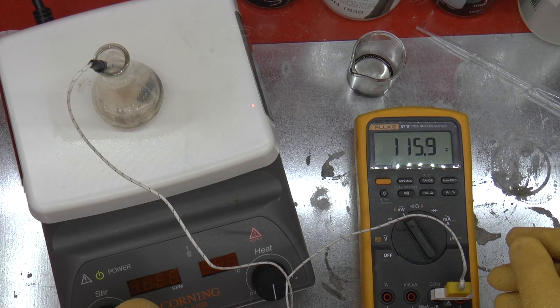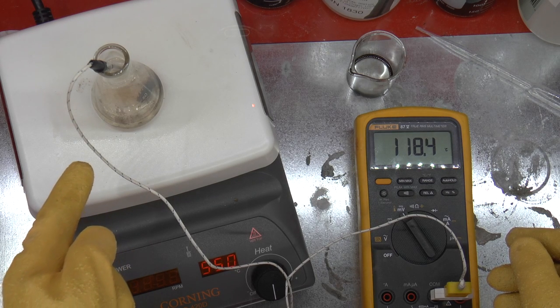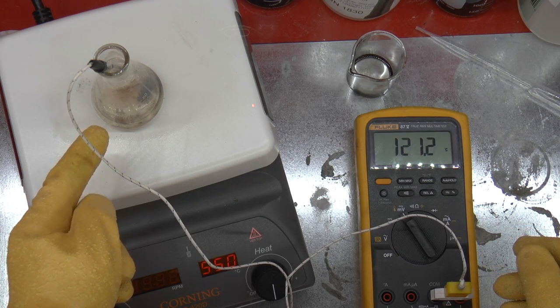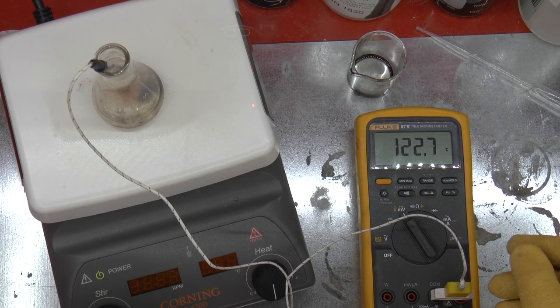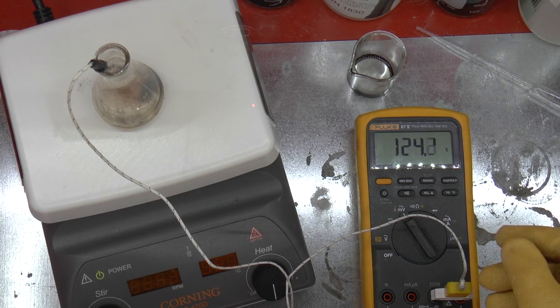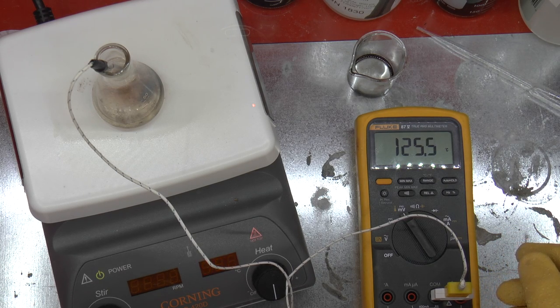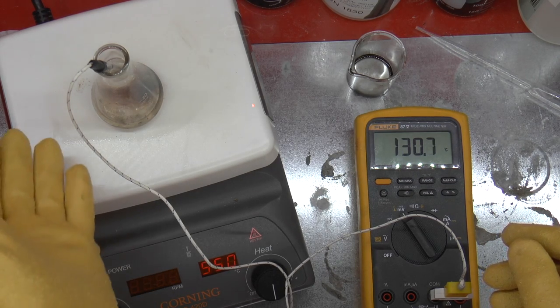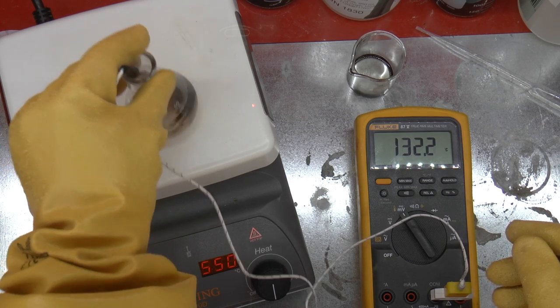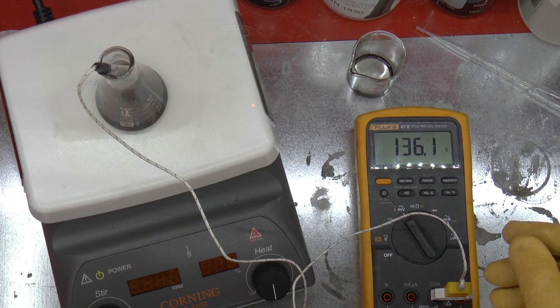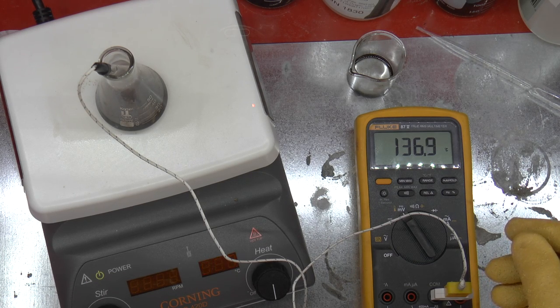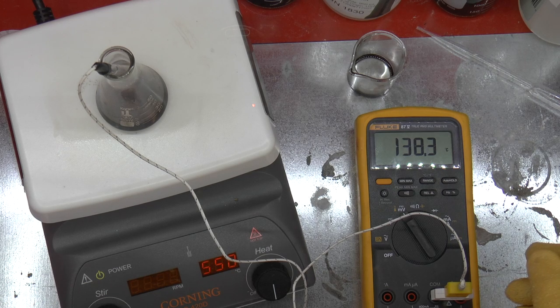What I want you to see is that around about 115, we start seeing some brown stuff coming off the chip. This will rapidly turn black. This is basically the carbon being dehydrated off of the resin, and it's essentially breaking down the resin. The solution will continue to turn blacker and blacker, and I can pick it up and swirl it around. The solution is basically black at this point. This is all carbon. This is good, it means the chip is being dissolved.